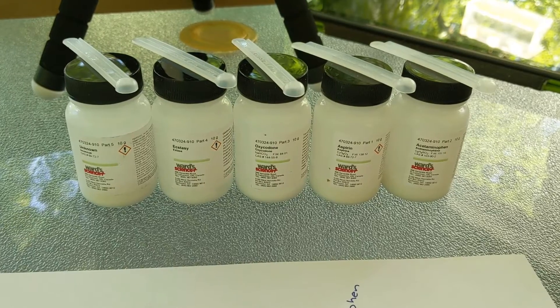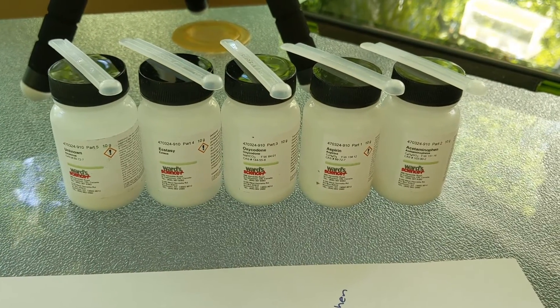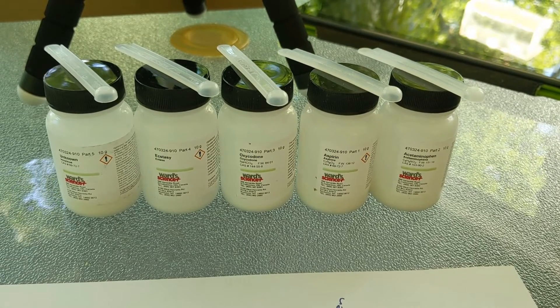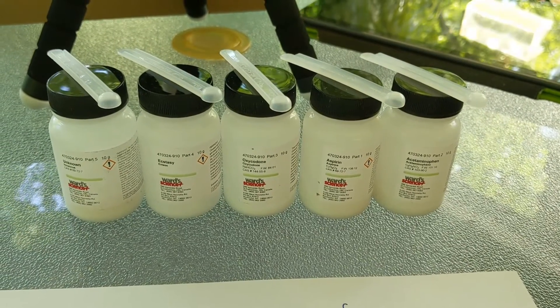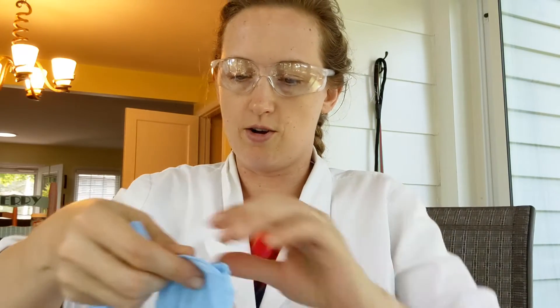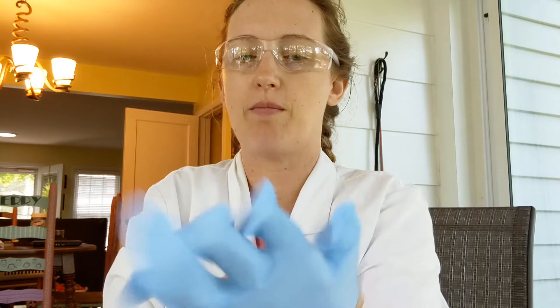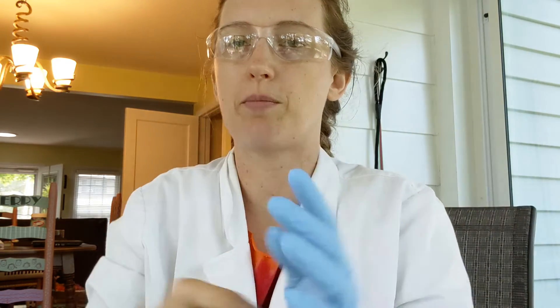Make sure that each of your scoops goes with just one of your bottles of chemicals so that you don't cross-contaminate your chemicals. Now I'm going to put on my PPE, because even though I'm working at my sun porch and not in my typical lab, it's still important to wear the proper PPE.